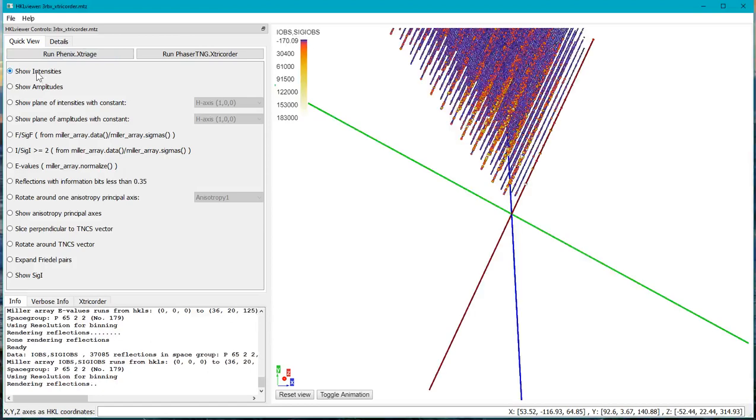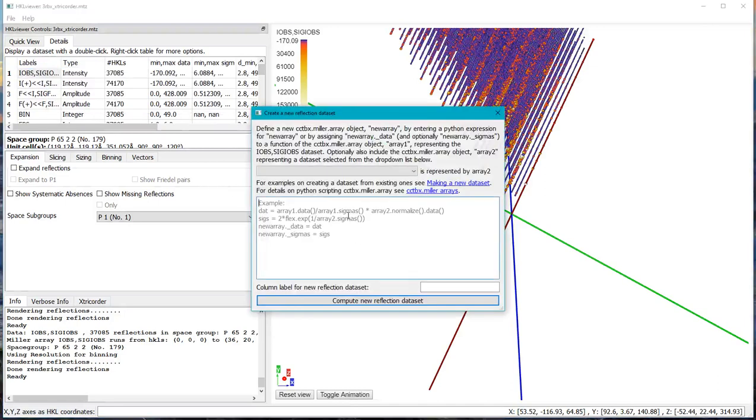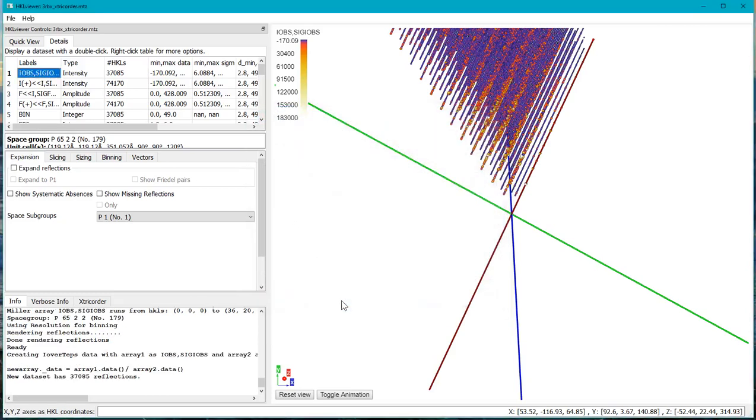Let's first display the intensities, and we go to the Details tab and find the intensities, and then we right click here and make a new data set, and we type new array._data equals array1.data divided by array2.data. So array 1 corresponds to the intensities here, and array 2 will associate with the TNCS correction terms, which we find here, and we give it a suitable name, the new array, and we call it IoverTeps, and unless I've made a mistake, this should compute.